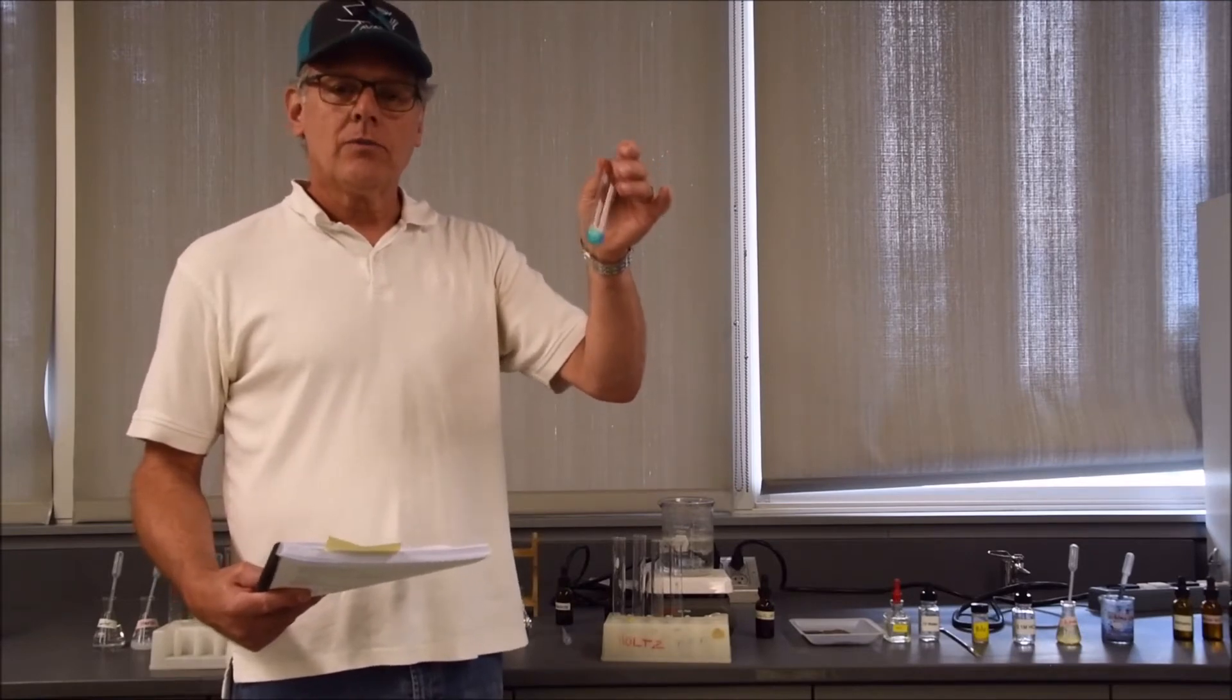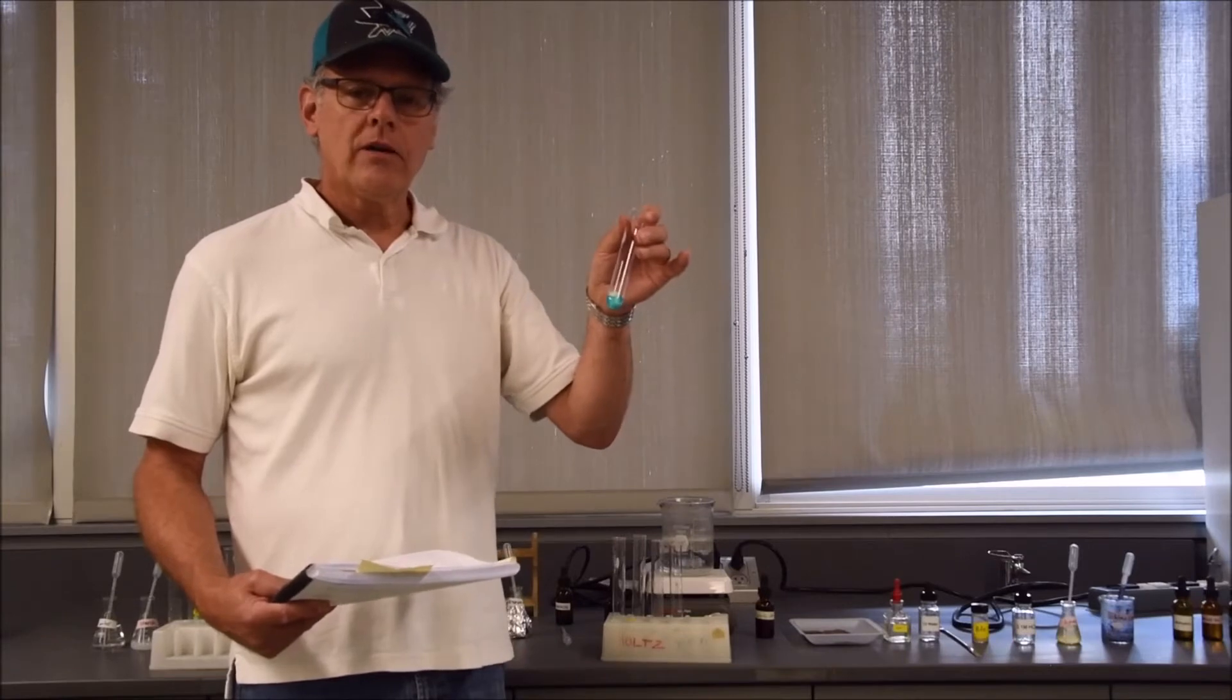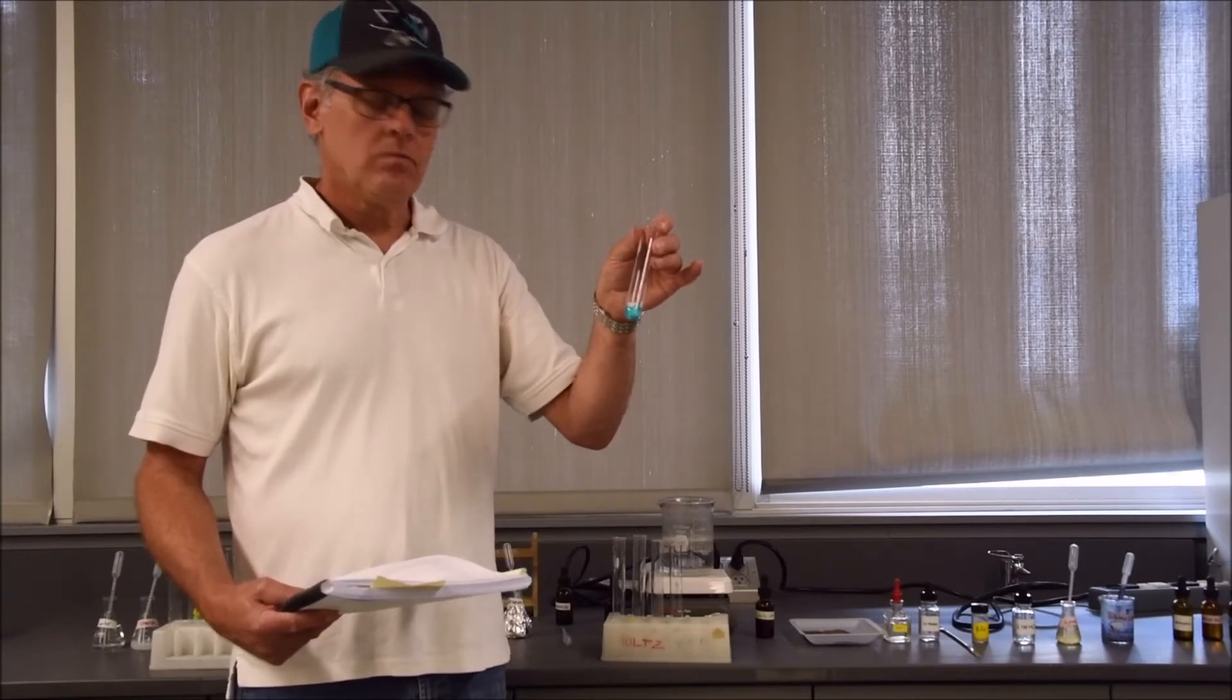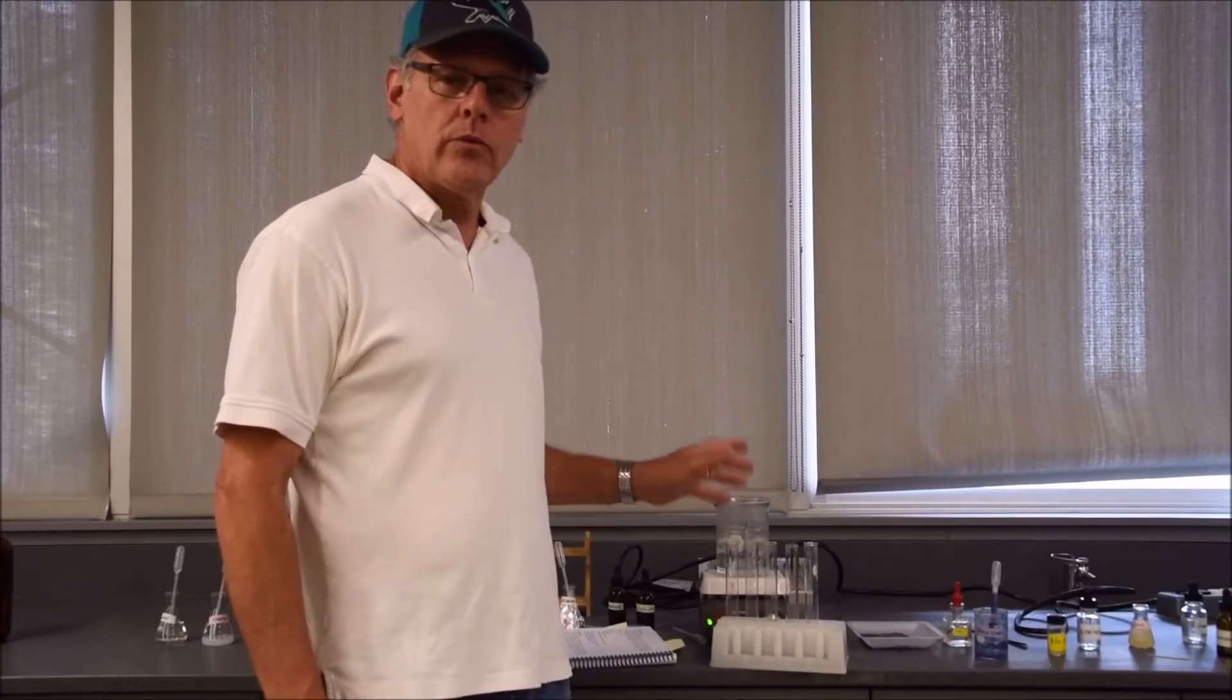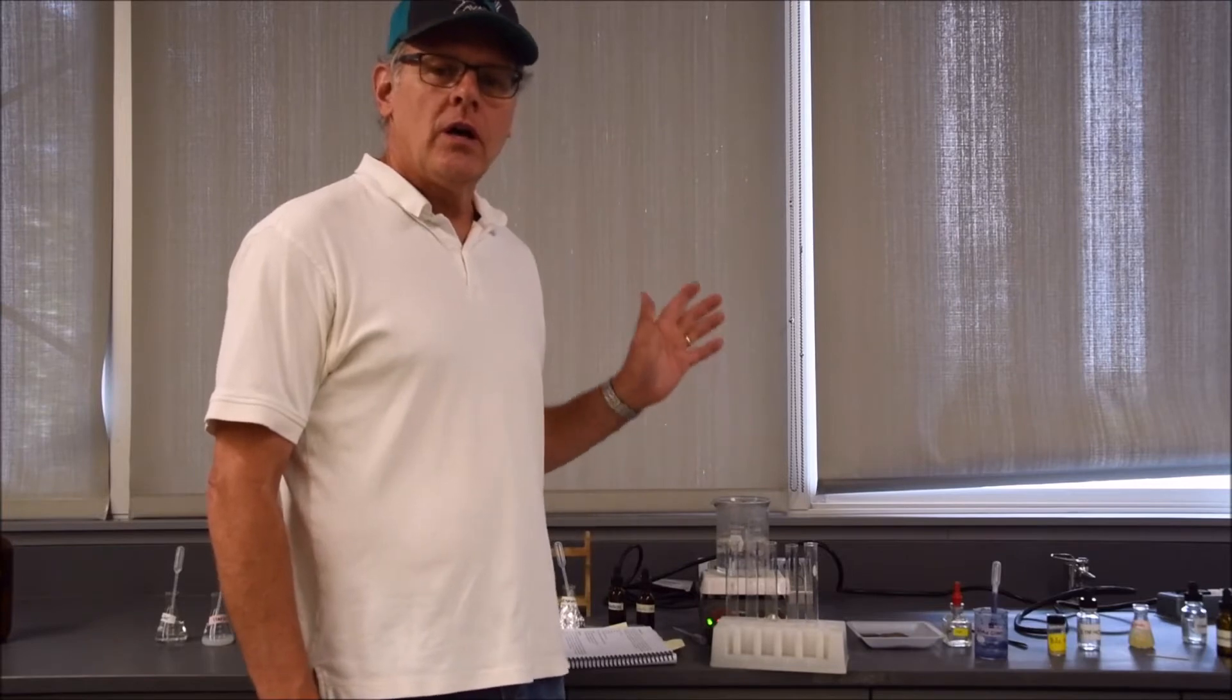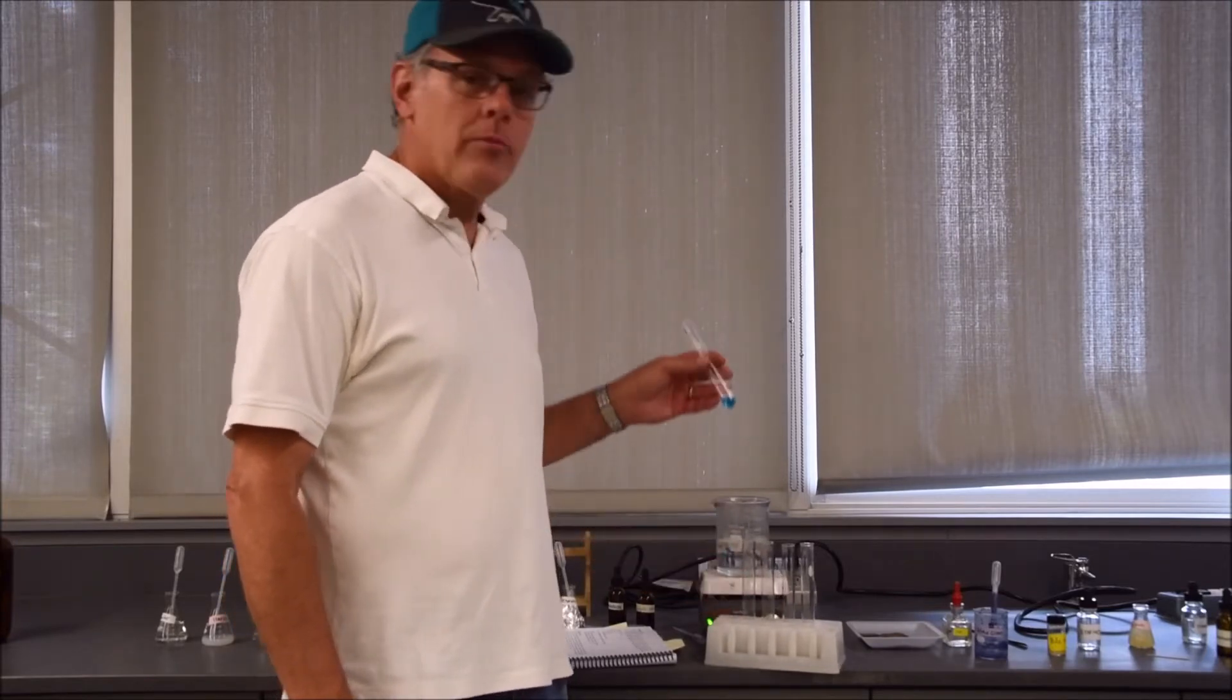I will put these to boil for about five minutes, and we will be back to show you the results. Let's take a look at the results of the Benedict's test. The test tubes were boiling. Remember what color they were originally. Most of them were a pale blue.